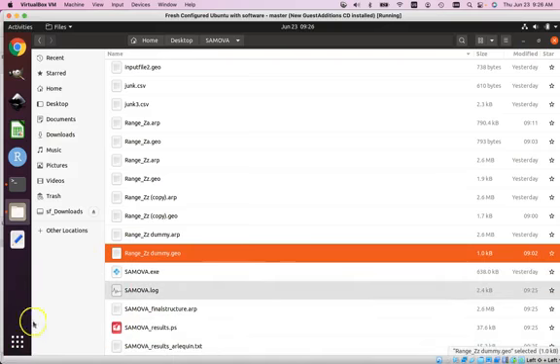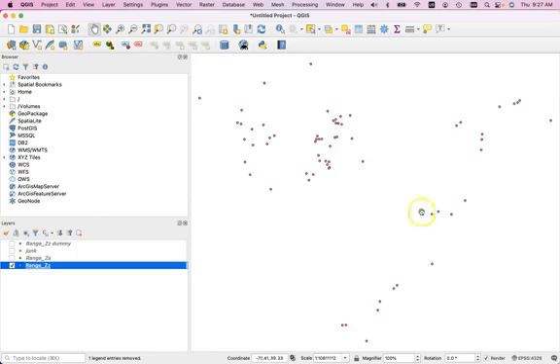So let's take a look at the actual locations of his specimens. So here's the locations of his actual specimens. It's a little unusual in that he has one group of specimens that are all over here and spread out, and then he has one group of specimens over here that are all clustered together. I suspect what's happening is that this software is creating some sort of triangles based upon these points to calculate the similarity of these points genetically to one another, something like that. And these triangles, if the shapes of the triangles is such that one of the lengths of the triangles is almost 0, that could give you this weird bisection error that we're seeing.